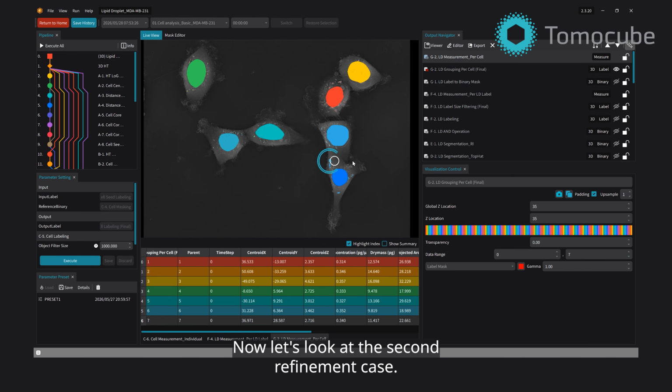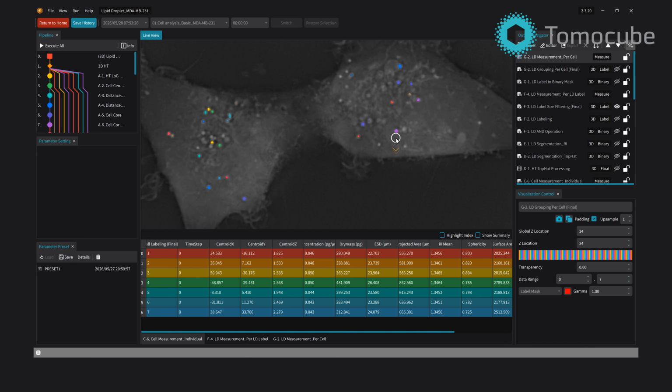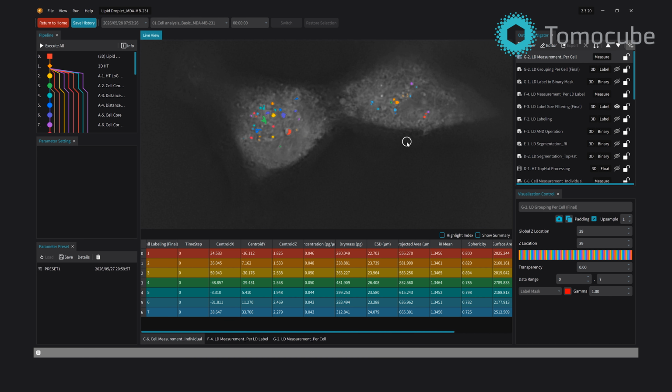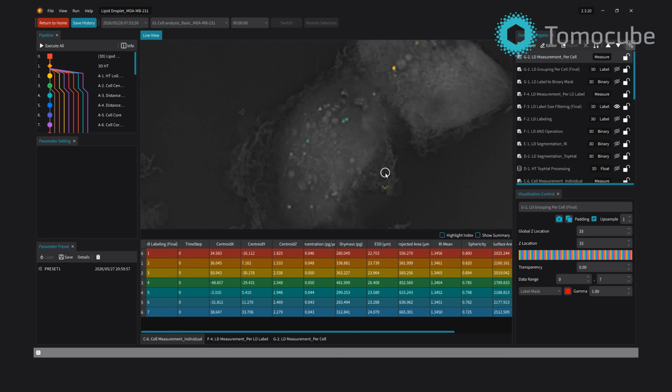Now let's look at the second refinement case. Suppose the lipid droplet detection looks too strict. Visually, you can see many bright droplets in the HT image that the pipeline failed to label. This usually means the refractive index threshold was set too high. The simple fix is to lower the threshold and rerun.